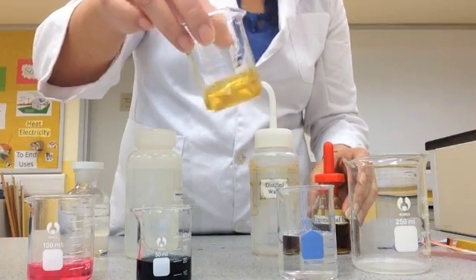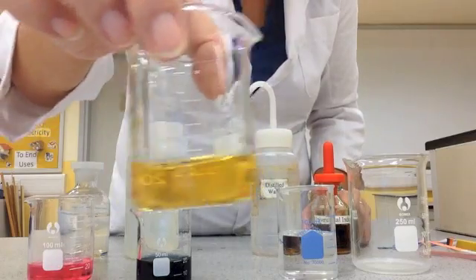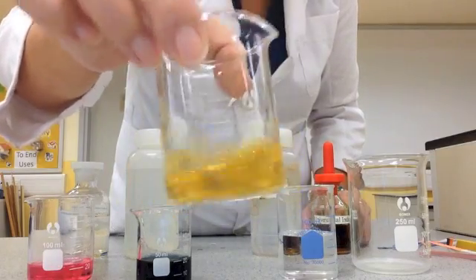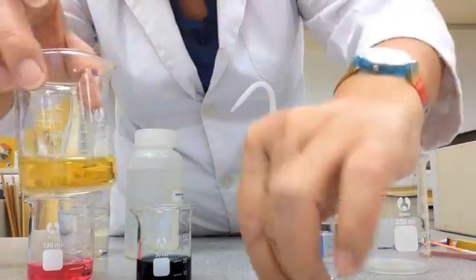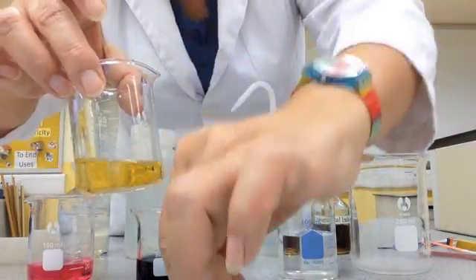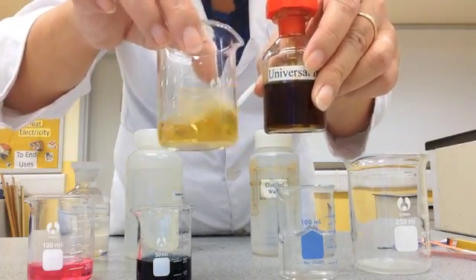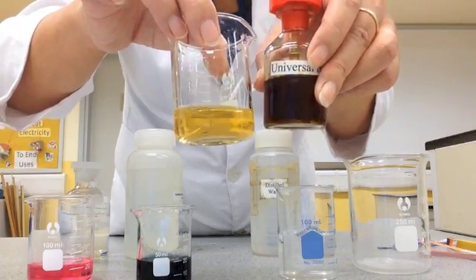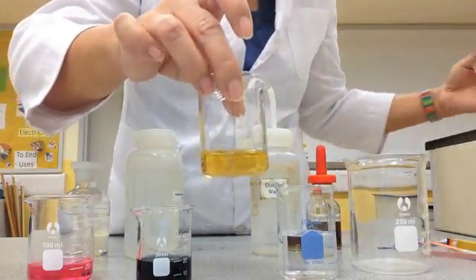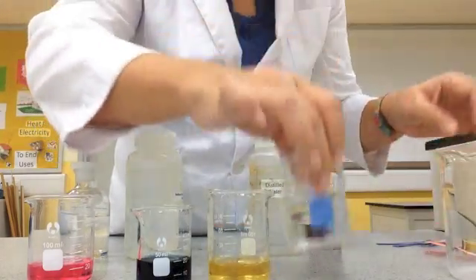The yellow universal indicator paper turned green, suggesting neutral. But with the liquid universal indicator, it turned slightly yellowish — so we're saying this one is probably slightly acidic.